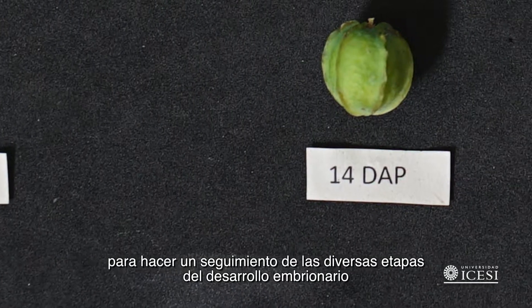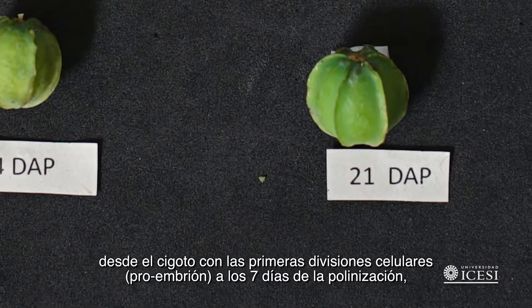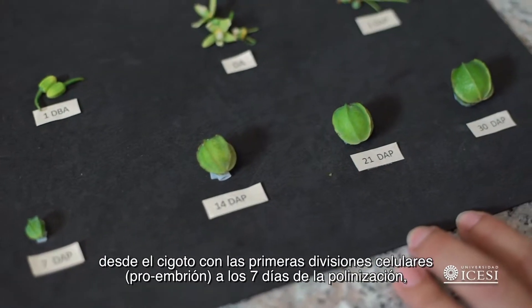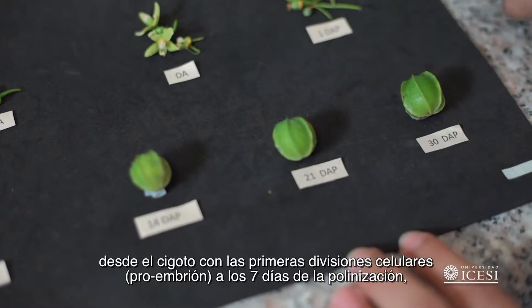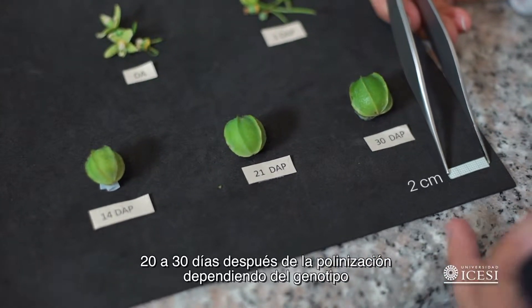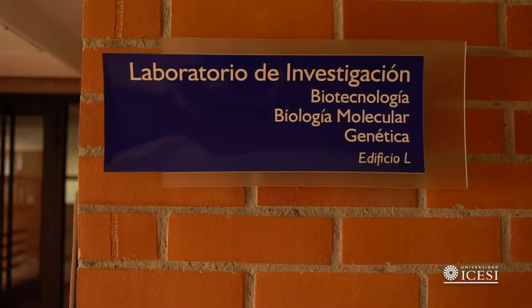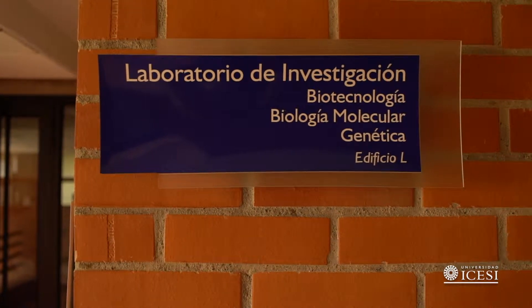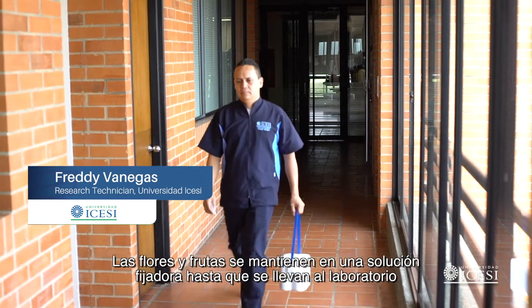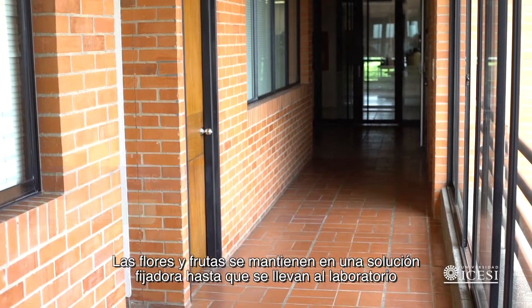This is to follow up the various developmental stages of embryo development from the zygote with the first cell divisions, pro-embryo at seven days after pollination, up to the embryos at the globular stage 20 to 30 days after pollination, depending on the genotype. The flowers and fruits are kept in a fixing solution until they are taken to the laboratory.